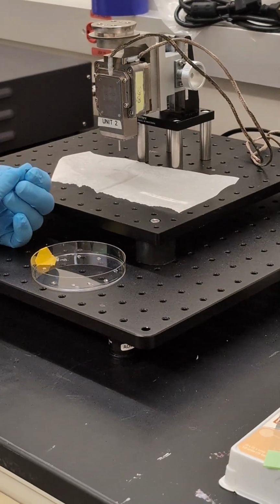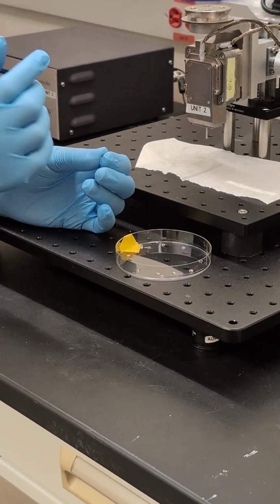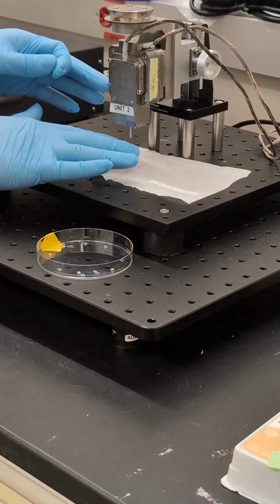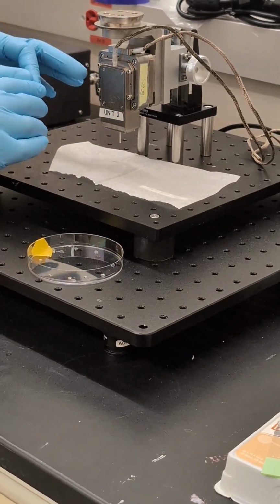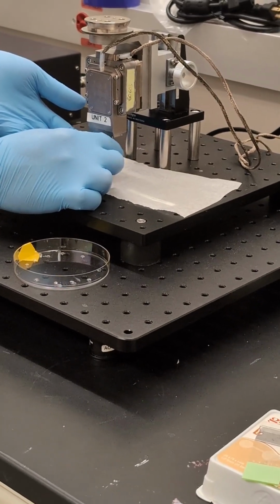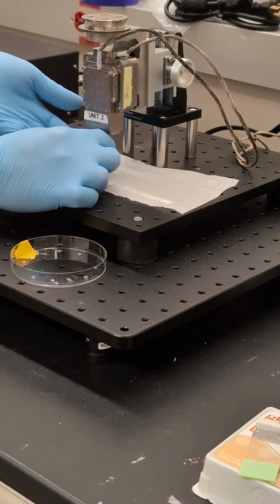What you can see here is actually a thread that allows you to screw it in. When you try to screw onto it, just follow the right-hand rule. But don't use too much force, otherwise you might damage the actual housing itself, because of the torque you exert onto it. So just be gentle. You don't have to screw it really tight, like finger tight is more than enough.